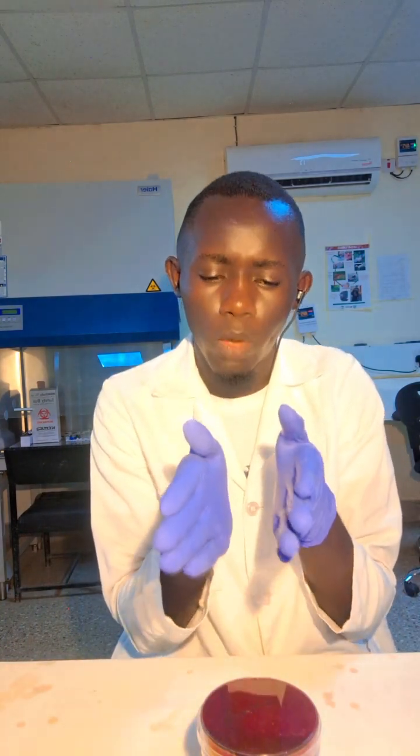If you have inoculated, you have placed your sample on this agar plate, streaking helps you to dilute those colonies, enabling you to get a pure colony. So streaking is just a mechanical way of separating the colonies in a mixed sample, in a mixed culture. So you separate the colonies. That is the one basic principle of streaking.